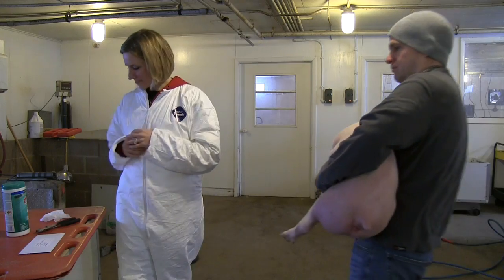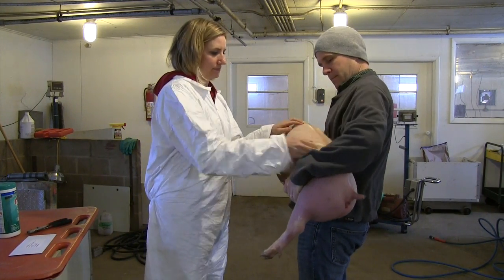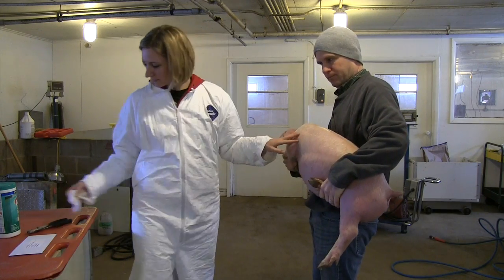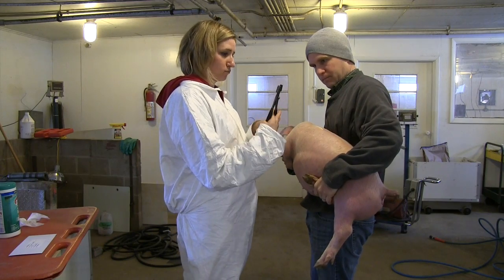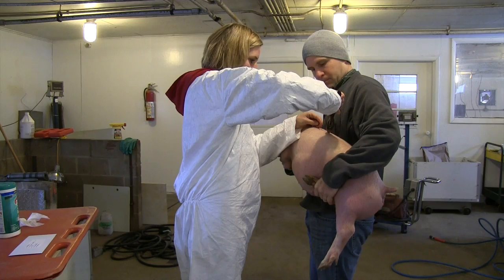So let's head out and show you how to collect the hair. First, you'll need to clean the hair collection area with a dry towel to remove any dirt or other contaminants. Recommended sites are on the loin or rump, but if the animal's been shaved, other areas could be used to pull hair samples as well. In our experience, the longer the hair, the easier it is to get a good grip and remove the follicle.